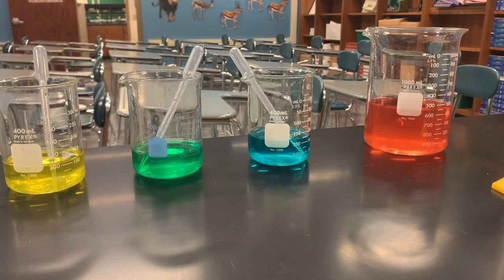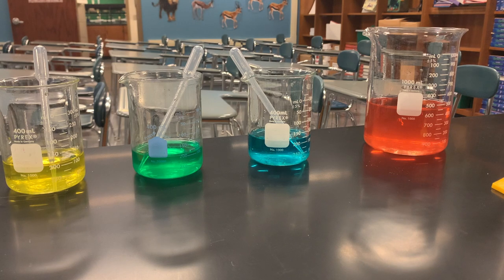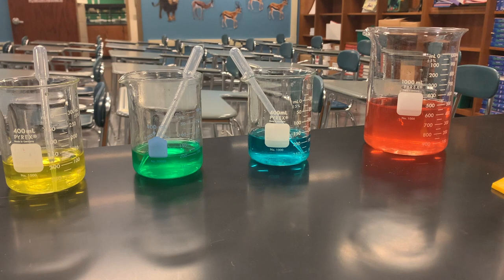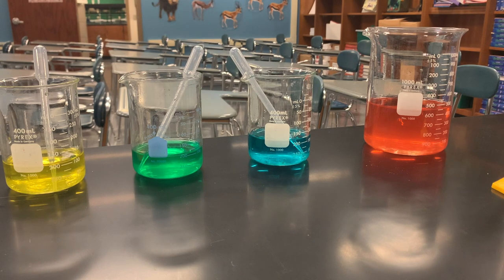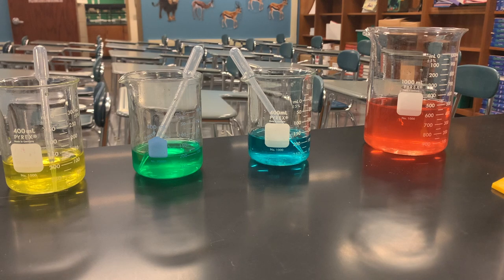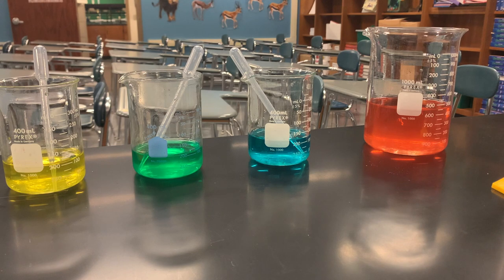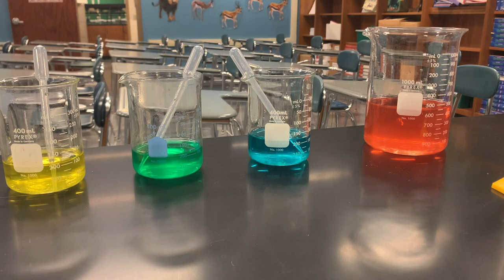We are going to be doing a lab in class today. If you are a remote learner, it makes it slightly difficult, so I'm running the lab for you and you can copy my data down and then draw your own conclusions from my data. What we're going to be doing today is just like in class we've been going over diffusion and osmosis, and today's lab is going to be on osmosis.